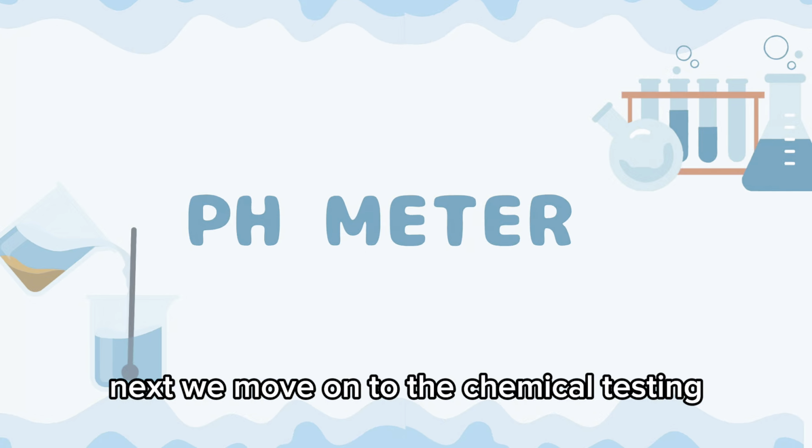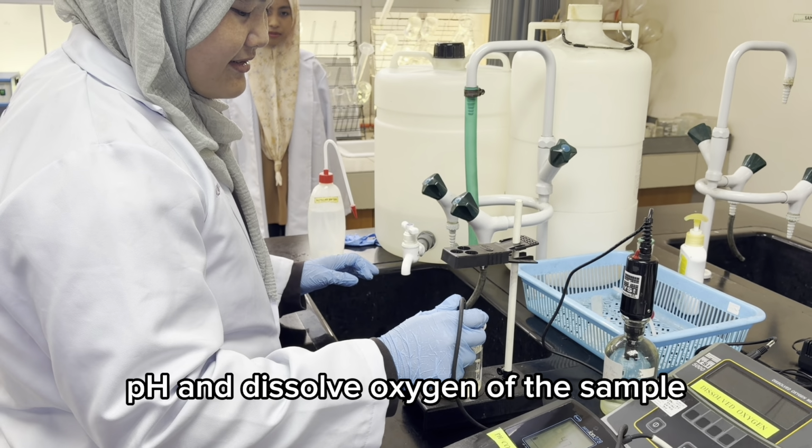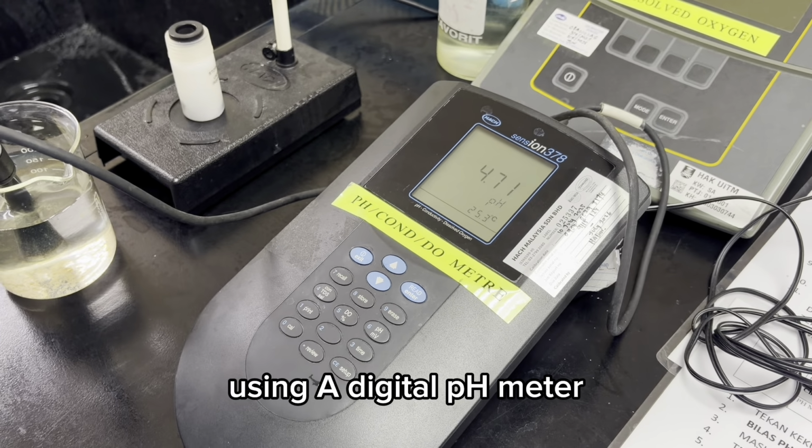Next, we move on to the chemical testing. We measure the initial pH and dissolved oxygen of the sample using a digital pH meter.